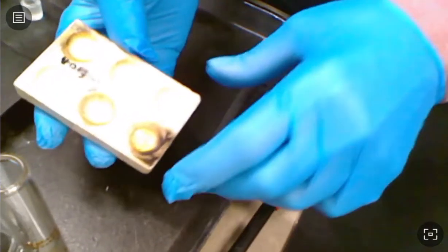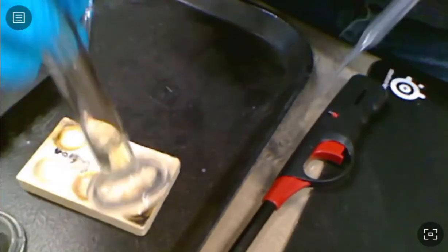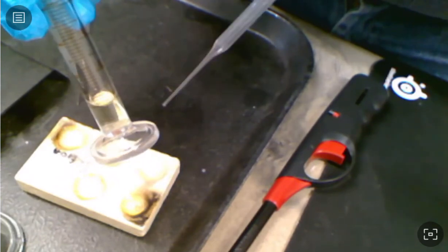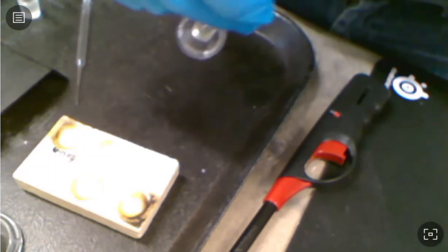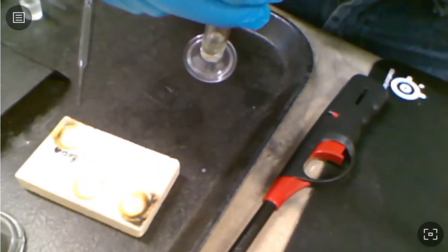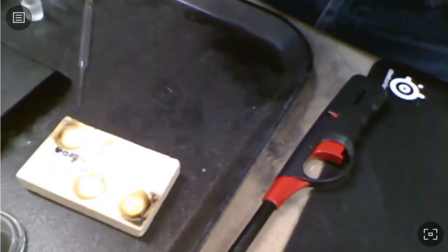To test it, we're just going to put a couple of drops of our gasoline in one of those wells and look at it. When we did our previous lab on incomplete combustion, when we tested gasoline, we noticed that it had a sooty flame because of incomplete combustion. So I'm going to go ahead and take a couple of drops of that out of here. Go ahead and just put it in the well. And I'll keep that pipette with my gasoline mixture.